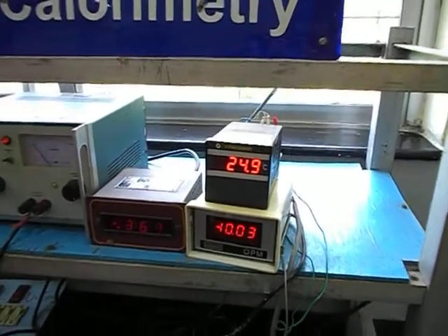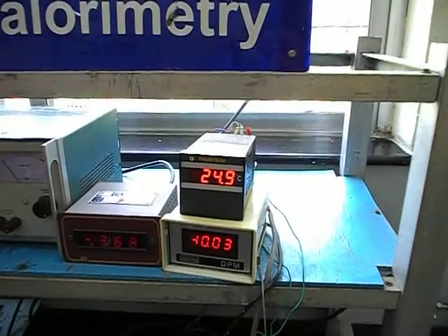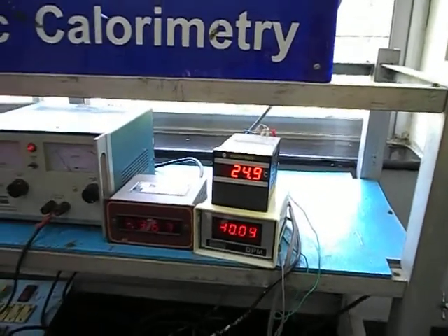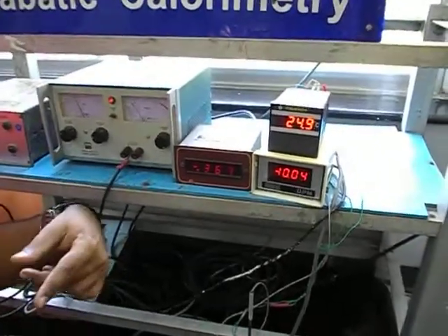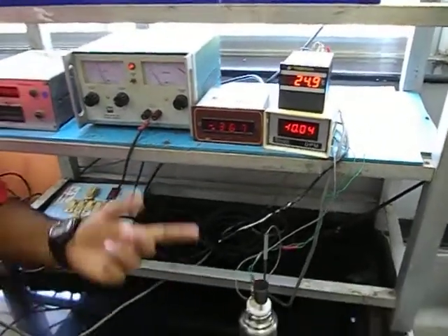So this temperature is noted down, and then we enter in the second fluid and again wait for the temperature to reach equilibrium T2.